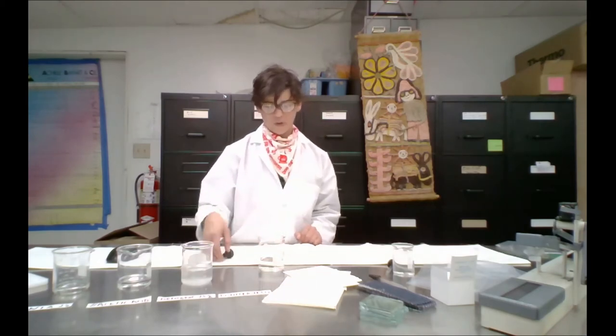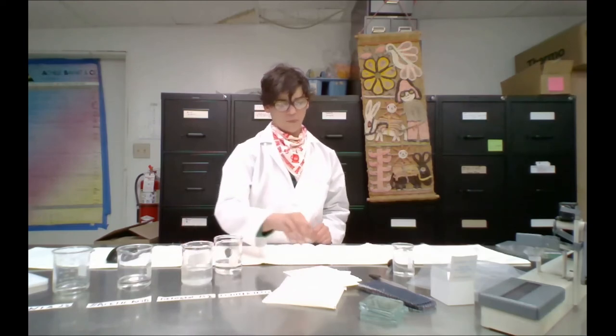So now that the sample is all wet, we're going to press it between the blotting paper and the plastic film.